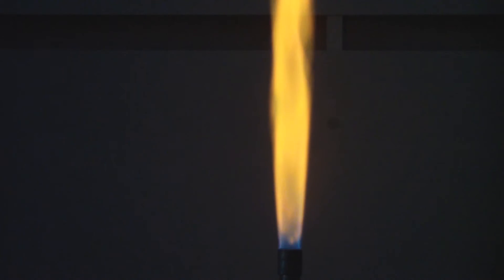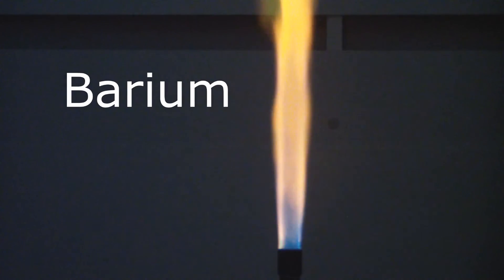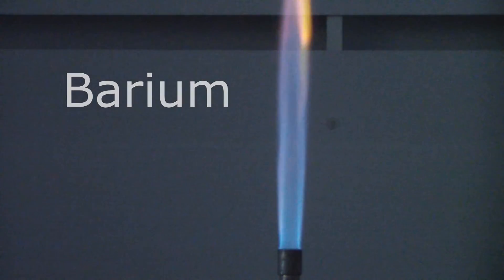Next one up is barium. And as we spray barium on the fire, you can see that it adds a lot more yellow into the picture there.